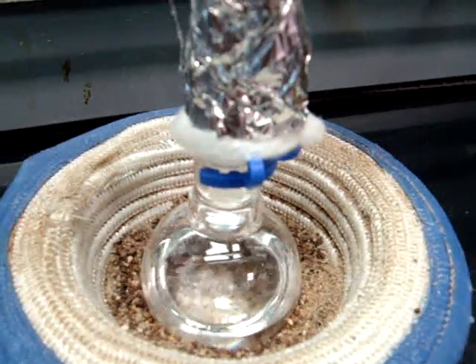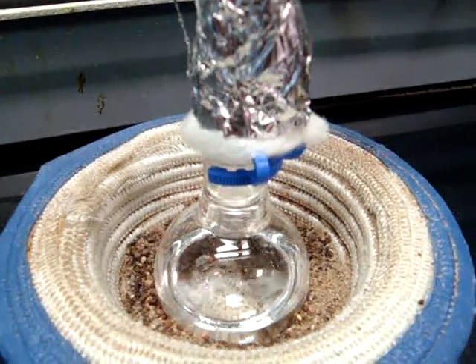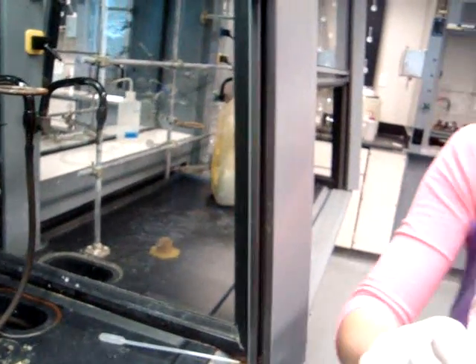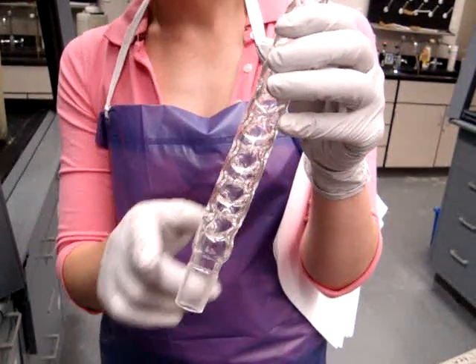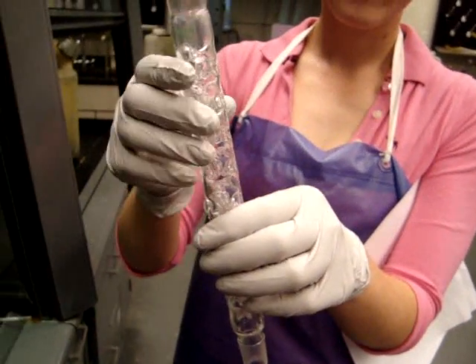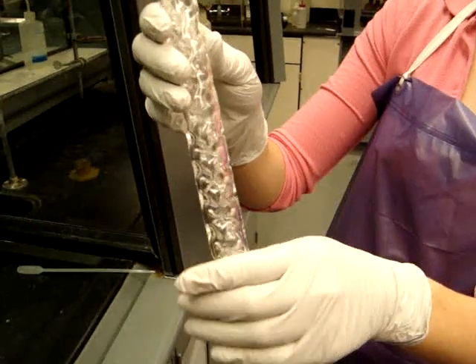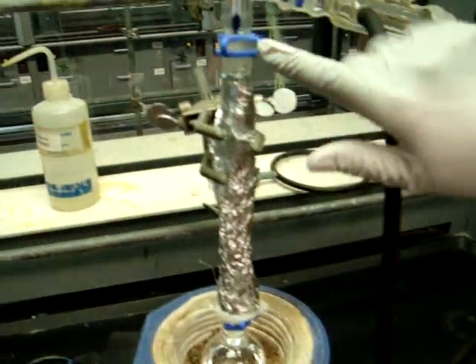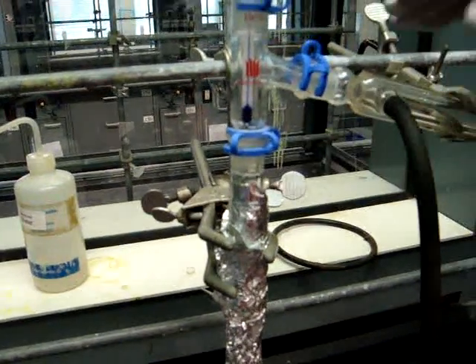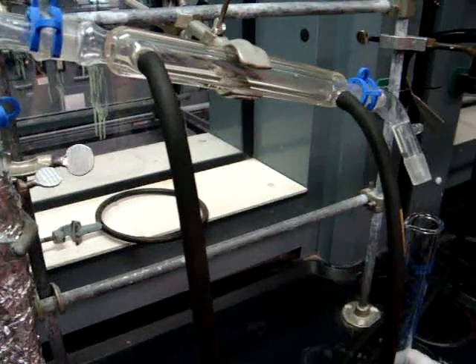As the mixture is boiling, you will have a cycle of condensation and vaporization of the components. Since cyclohexane is highly volatile and low boiling, it will continually vaporize and then condense back as one theoretical plate, so you will have mostly fractionated cyclohexane at the top, whereas your fractionated toluene will remain at the bottom. Your cyclohexane will come up as vapor through the fractionating column, condense back to a liquid in the condenser, and be collected in your graduated cylinder.